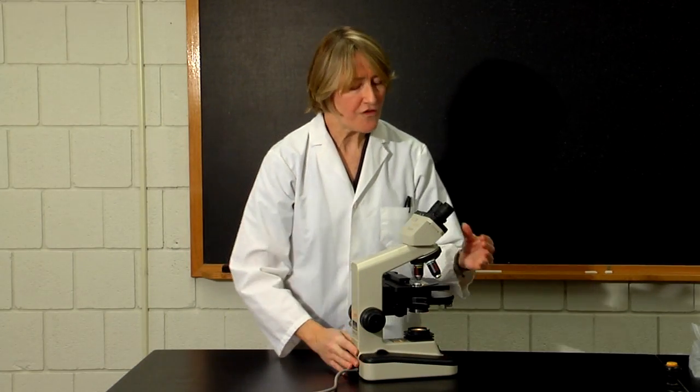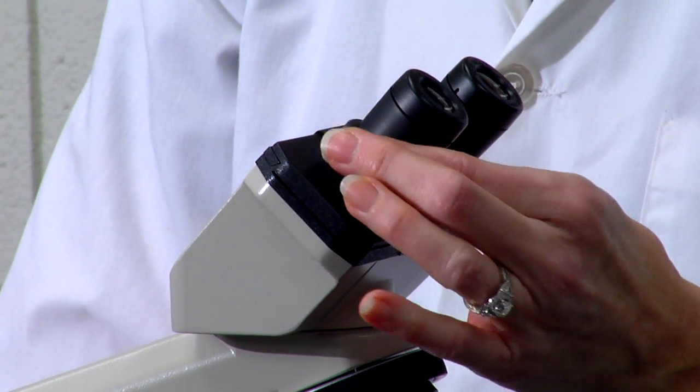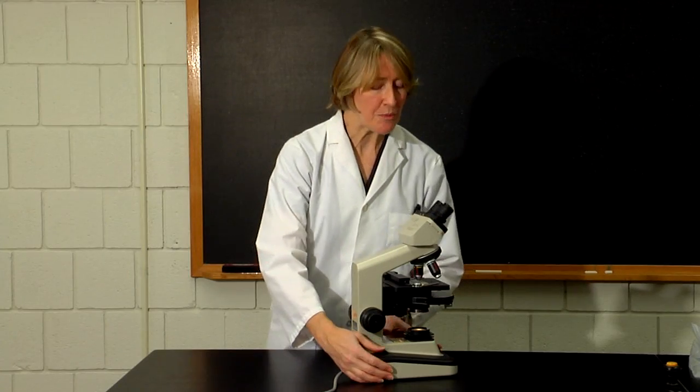You can also adjust the focus of the ocular lens for your own eyes by adjusting the diopter ring on the ocular lenses. This is further explained in the microscopy section of the appendix of your lab manual.